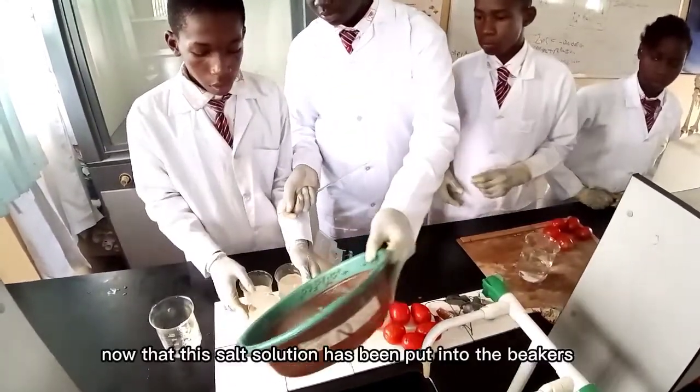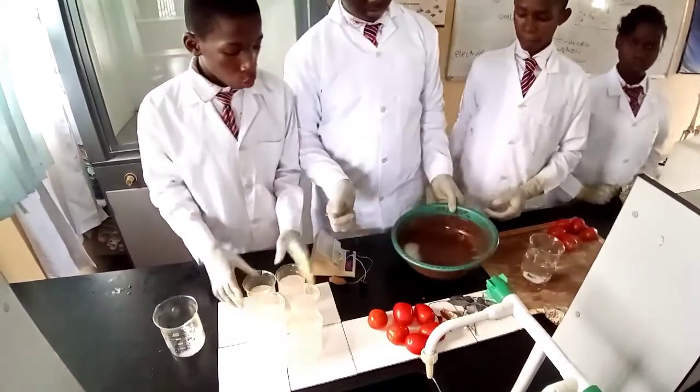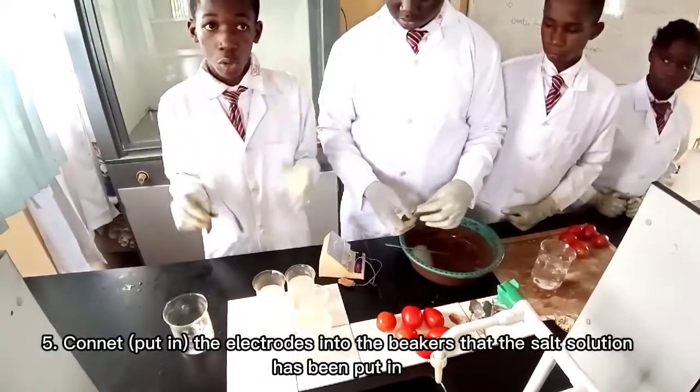Now that this salt solution has been put into the beakers, you put the electrodes into the beakers that the salt solution has been put in.